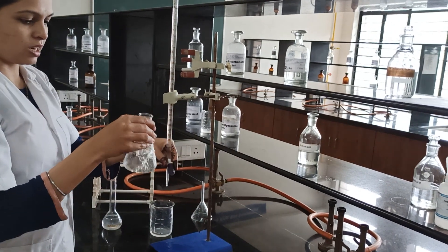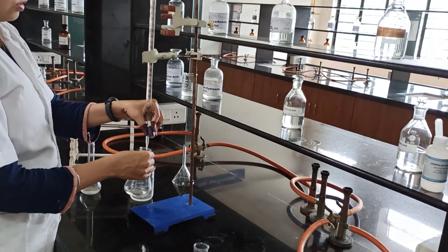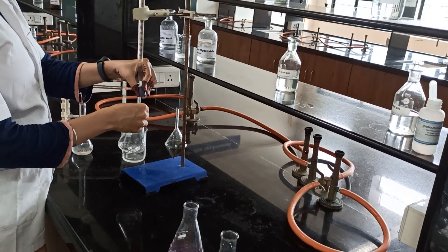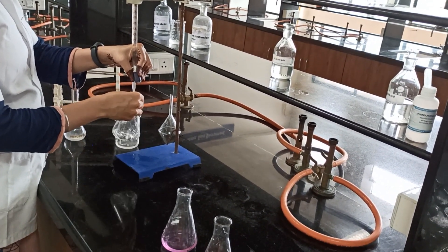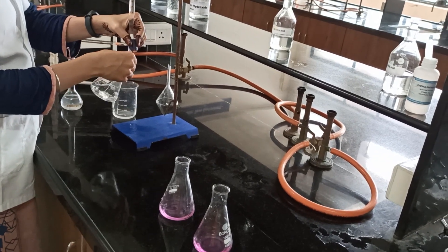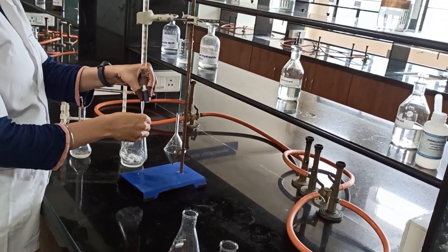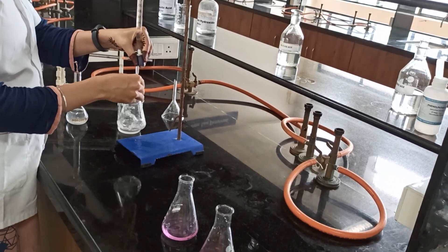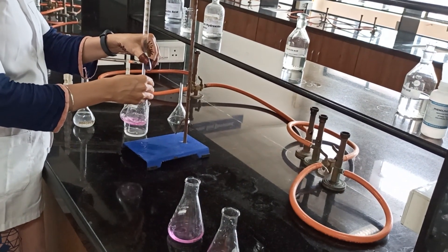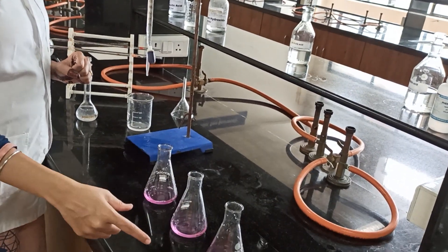Same potassium hydrogen phthalate, 0.1 gram, 15 ml of water, and 2 to 3 drops of phenolphthalein indicator. Titrate with 0.1 normal NaOH. After complete titration, it will give the endpoint that is colorless to pink. Initially there is no color change, but after complete reaction a color change to pink is observed. That pink color should persist for 30 seconds. In this way, we have completed the 3 readings.